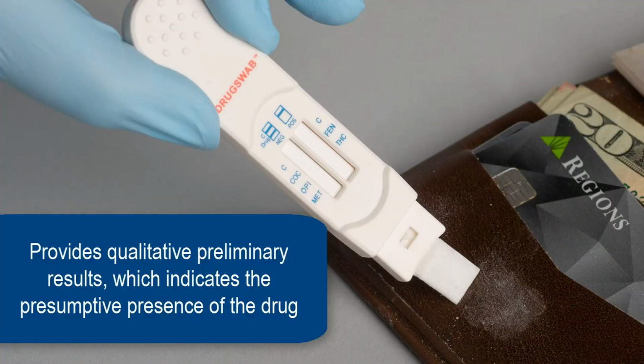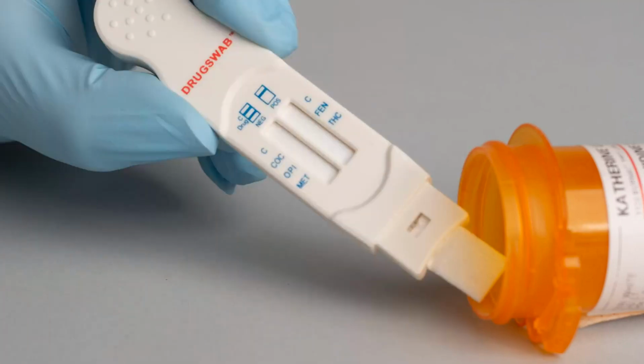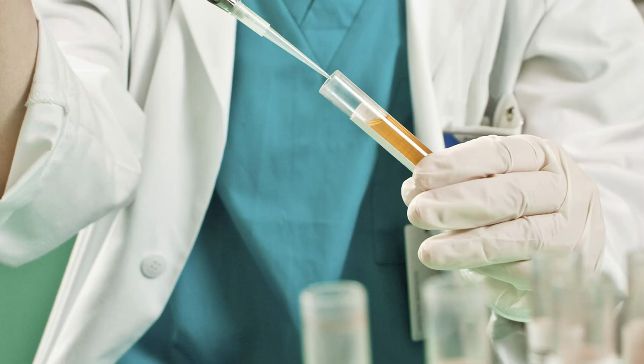The drug residue surface test provides qualitative preliminary results, which only indicates the presumptive presence of the drug in a residue or substance. It does not measure drug levels. It is not possible to determine the amount of drug present in the sample, only the possible presence of the drug. Drug Swab is intended for use as a preliminary screening test and is not intended for use as an evidential test. If Drug Swab identifies the presence of drugs and evidential results are required, have the sample tested by a laboratory to confirm results.